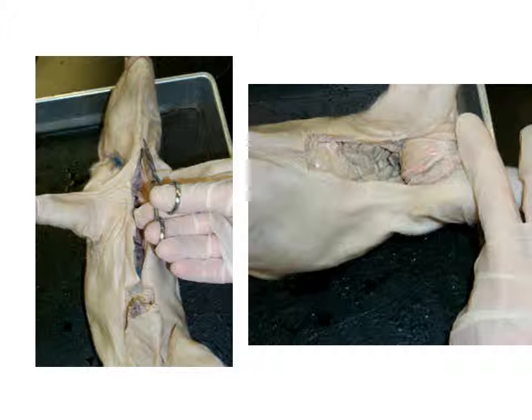When you open this up, do pay particular attention to the diagram in your book. That kind of U-shaped cut will come in very handy. It'll keep things tidy so that when you have to later go in and get the respiratory system, your tissues will be nicely preserved for that. Again, there's layers to the skin. Try to probe them, but don't spend forever on them.